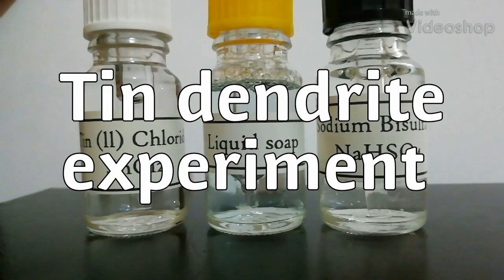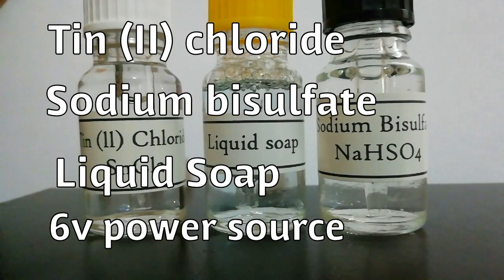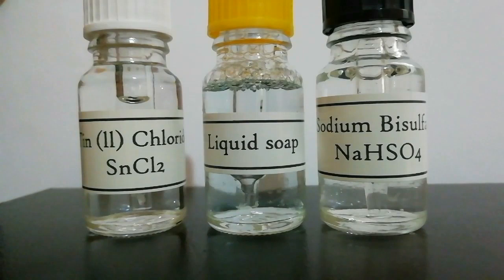Here is a wonderful experiment you can do at your home. For this experiment you need tin(II) chloride, sodium bisulfate, liquid soap, and a 6 volt power source.